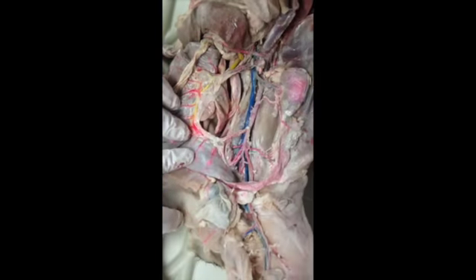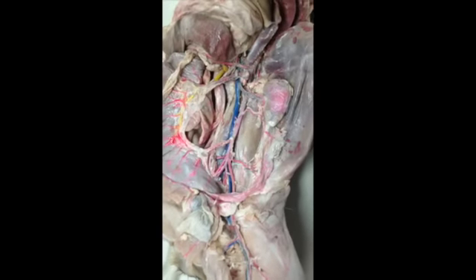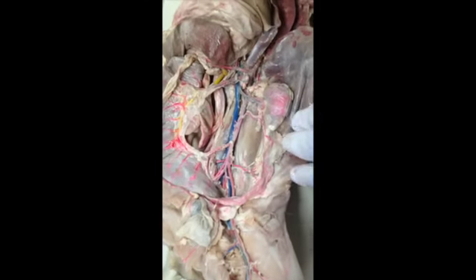Are these referred to as common? The veins? No, no commons. Sounds like not. Okay. No commons.